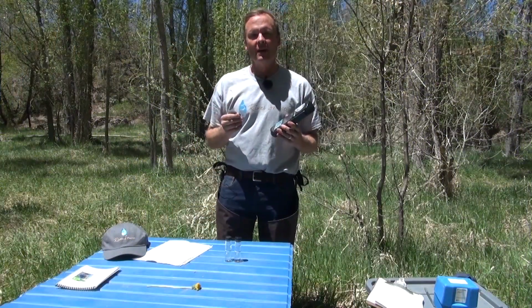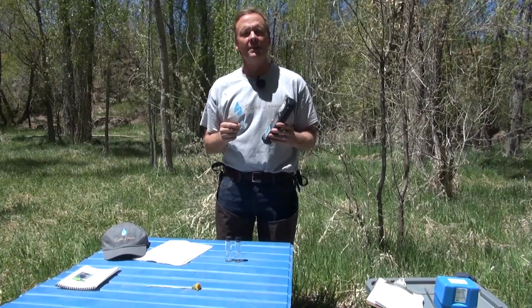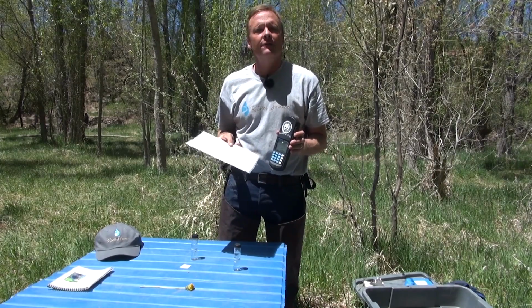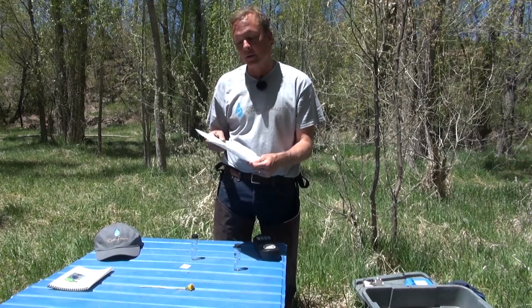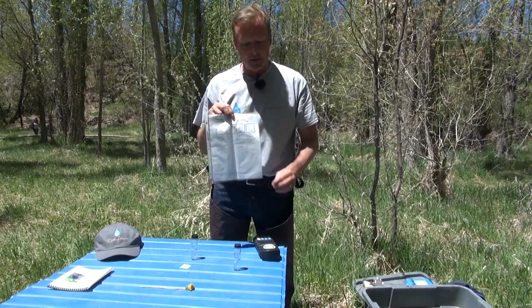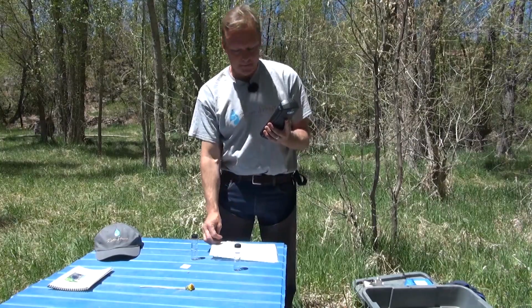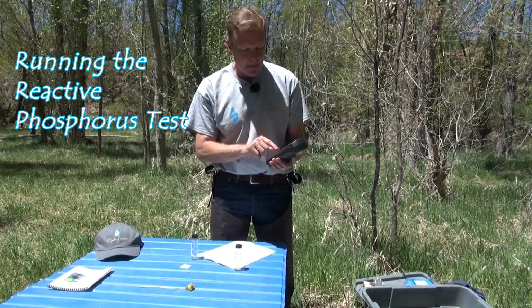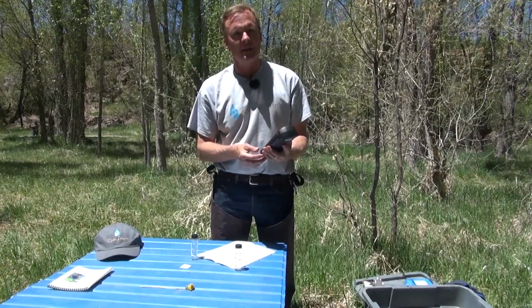Okay, now we're going to run the colorimeter test, which can tell us the concentration of nitrate nitrogen or reactive phosphorus. We're going to use an instruction guide from the Hach Company on how to use this machine. So we've made a photocopy of it and put it inside a sheet protector, and this 2-sided sheet right here is going to tell us what to do. The first thing that we need to do is go ahead and program the machine so that it's going to be reading for the right test. This says press the program button and 7-9, and then I press enter, and then it's going to dial in to the right test that we want to take.